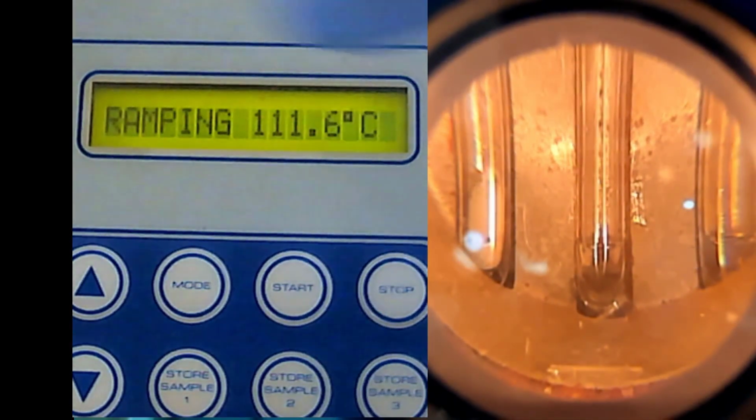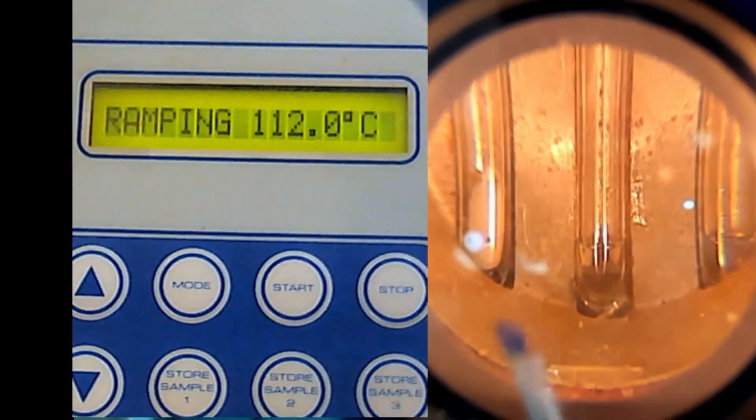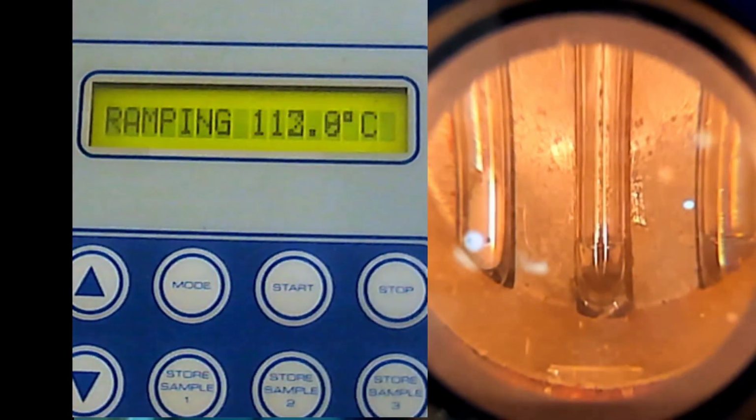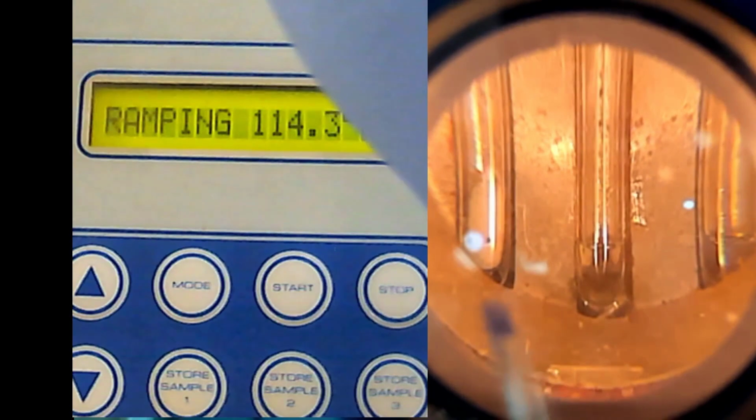I will not tell you what this is and what this is, because you have the melting point for your unknown, and from this, without me telling you, you will know what your unknown is. So you discuss. You tell me in your lab report what is the possible mixture of this, what is the possible mixture of this, and what is the possible mixture of this.